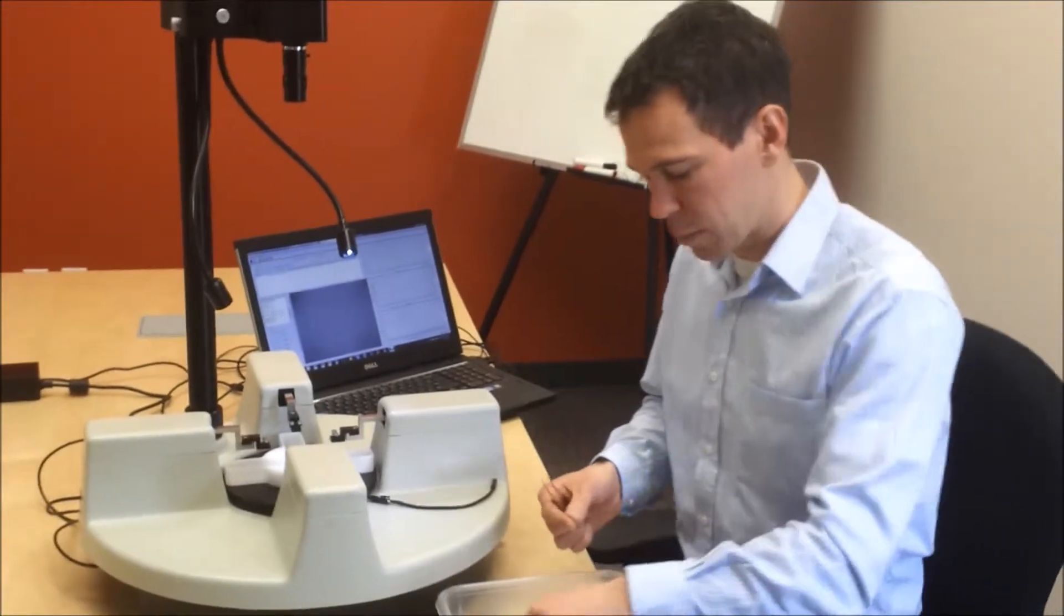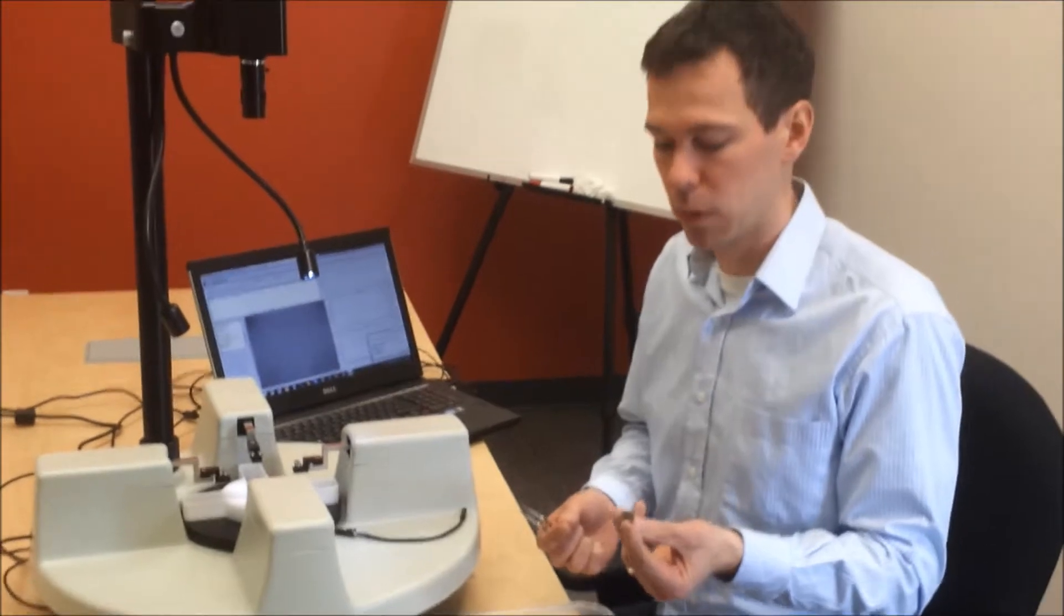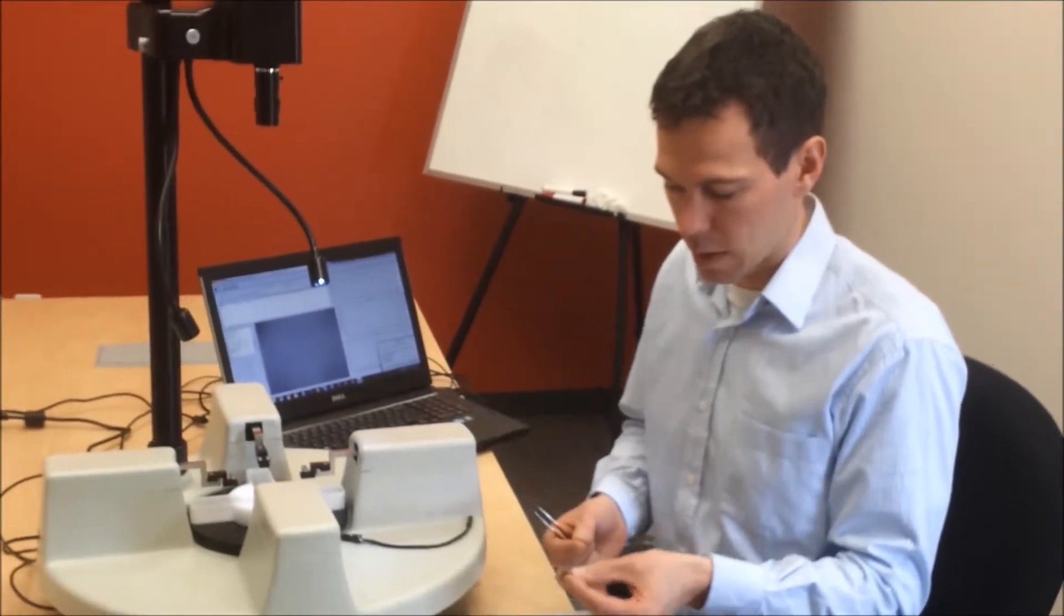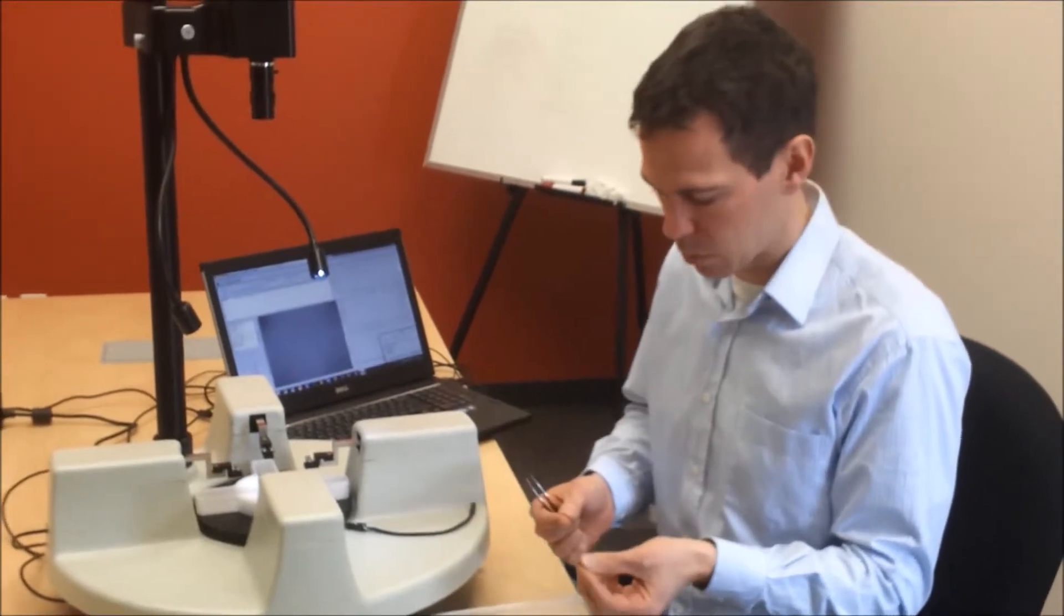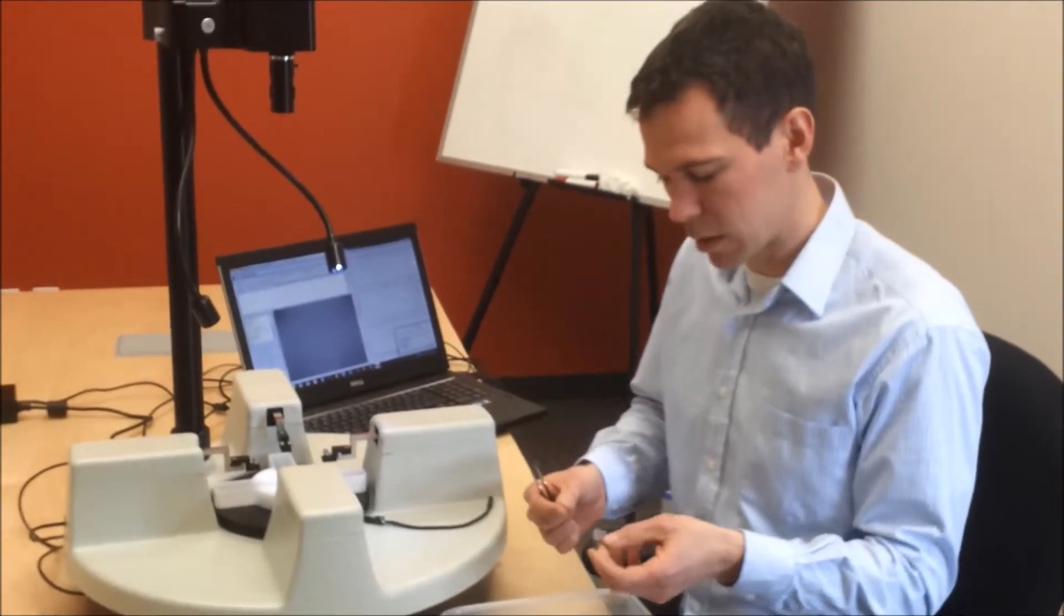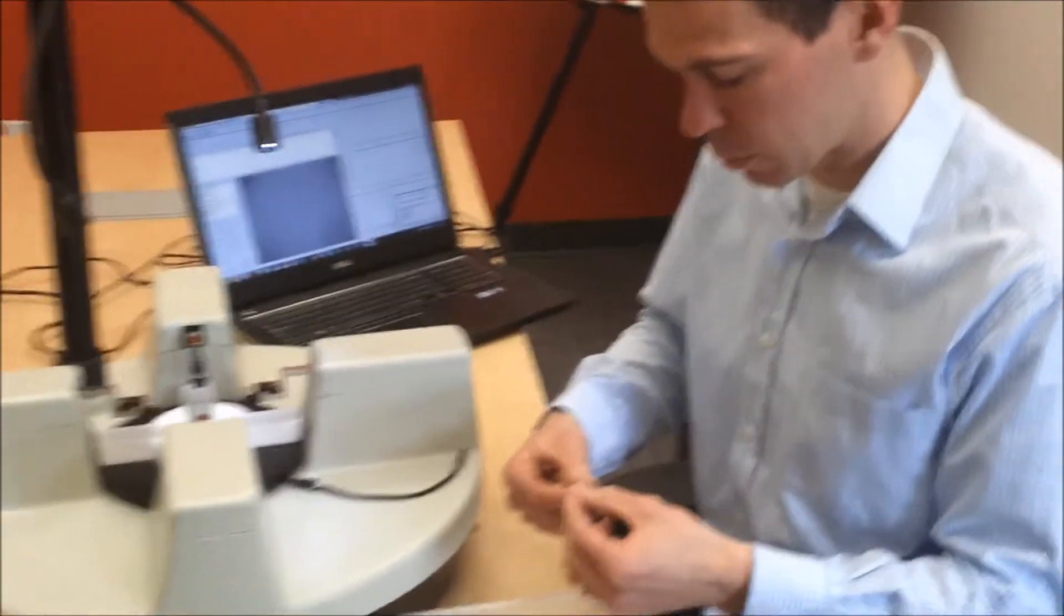Once you've got this set up, and in this case I have a spare piece of rubber that I'm using as my surrogate for my sample, and it's cut to about 16 millimeters square, 15 millimeters square maybe. And I'm going to place the hook through the sutures along each side of that specimen.